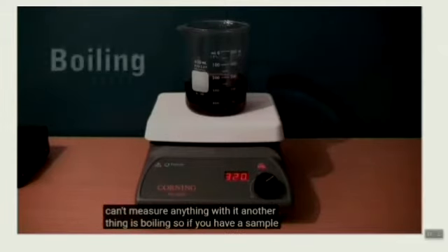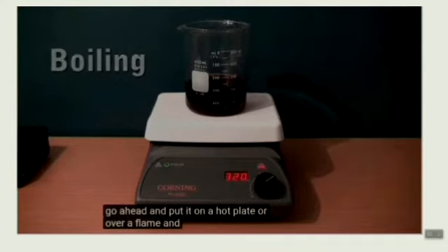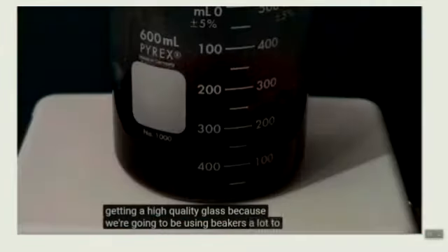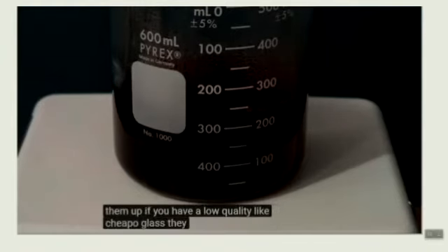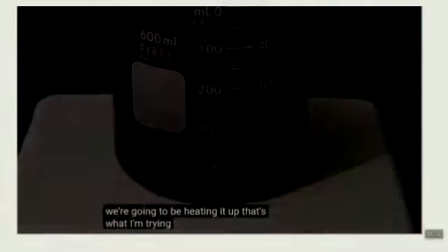If you have a sample that you just need to heat up or a solution that you need to boil, you can go ahead and put it on a hot plate or over a flame. That's why I recommend getting high quality glass, because we're going to be using beakers a lot to heat up solutions. Whenever we heat them up, if you have low quality cheap glass, they usually crack, so high quality glass is awesome. That's what I'm trying to say.